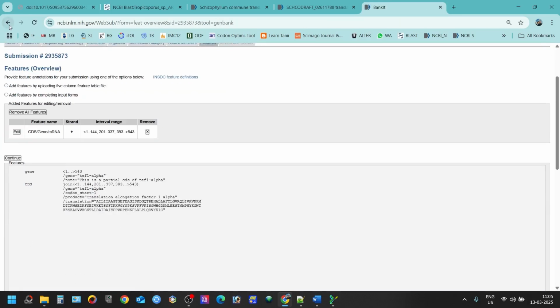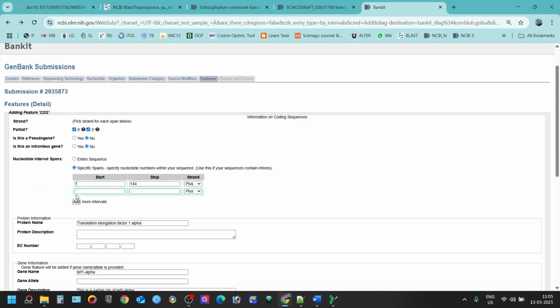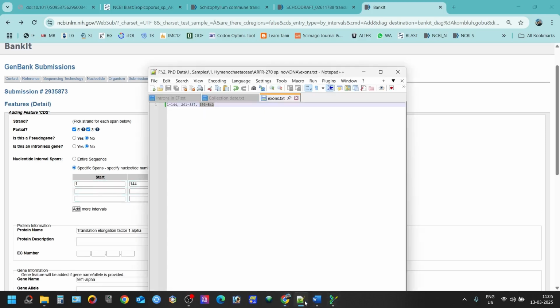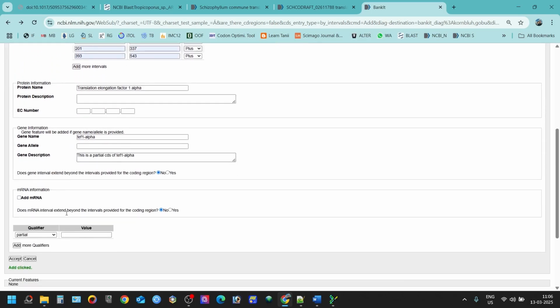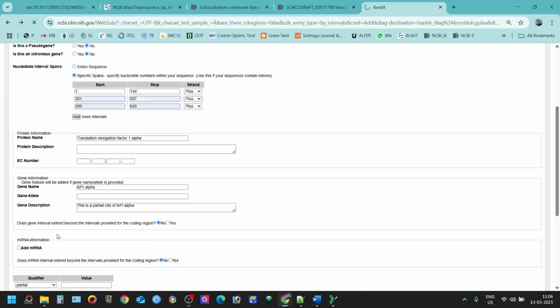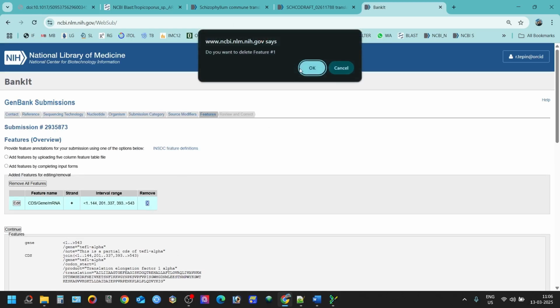So it has worked, but in some cases it might not work. I have to remove all these things, just to show you something. I'll show you right now.